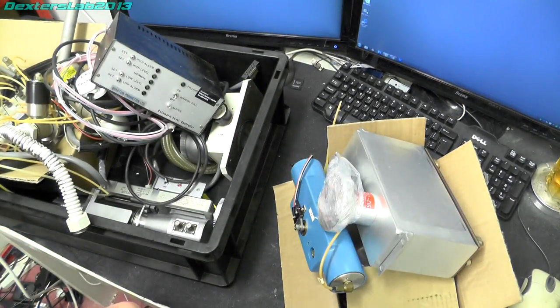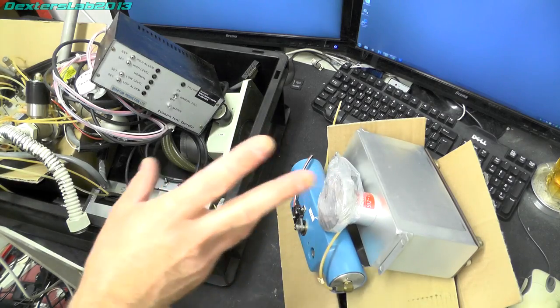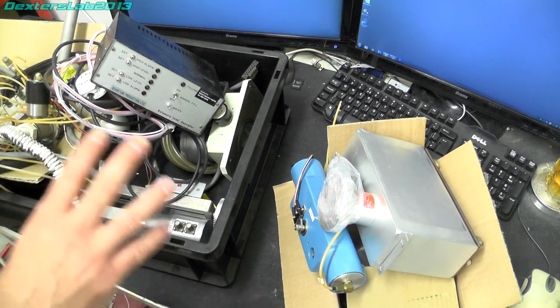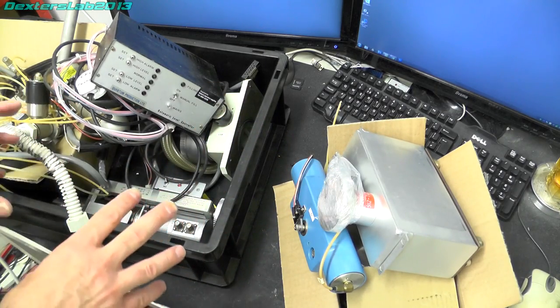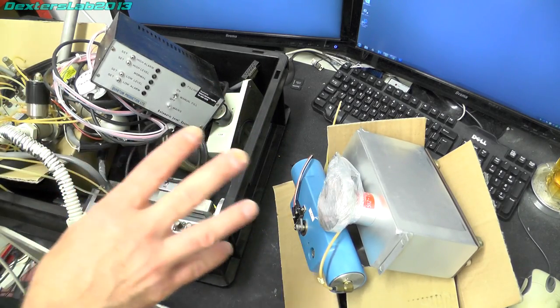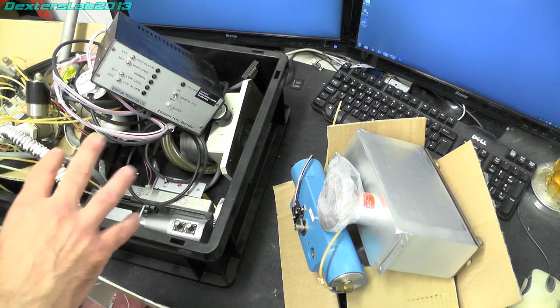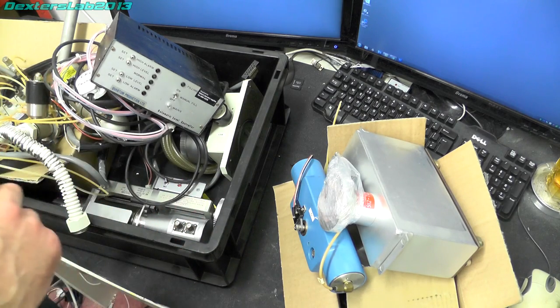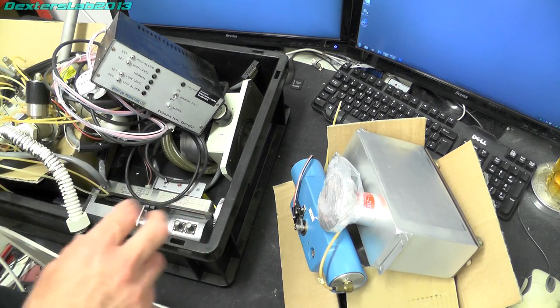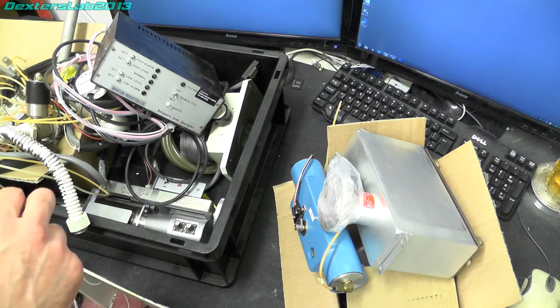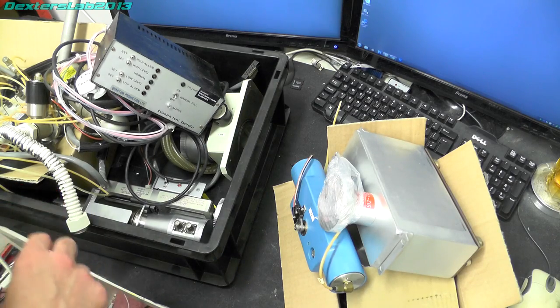So I thought I'd take a few minutes just to run through all the parts of the SEM teardown that I have saved. The main chassis and large chunks of metal will be heading off to metal recycling.